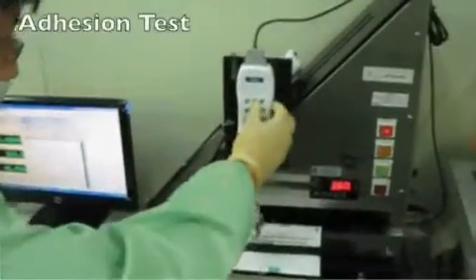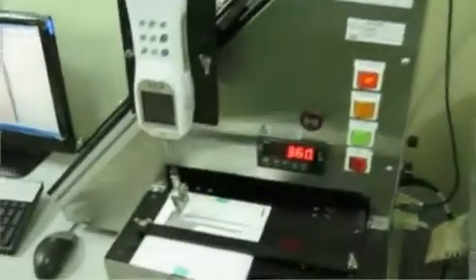That test is the adhesion test. A strip of 1 cm or 10 mm of backsheet is cut and inserted into an instrument that applies a peel force. Our leading paste must exceed 4 newtons of peel strength throughout the test. We have other paste that can tolerate up to 40 newtons of force, should that be required. The screen here shows 7 or 8, as you can see.